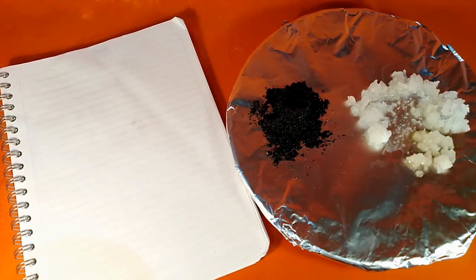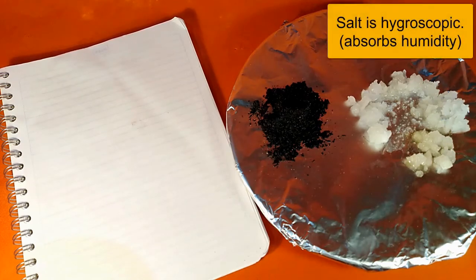And what's going on is that the salt is what we call a hygroscopic material. And this is a big word, but all that it means is simply that the salt absorbs water out of the atmosphere. The humidity condenses onto the salt, dissolving some of the salt, and you can even see evidence of all that water. It's wet down there. I guess that would be an aqueous solution of salt water, right? We know that salt dissolves in water, and not only will salt dissolve in water, but it's basically going to absorb humidity out of the atmosphere such that it dissolves.